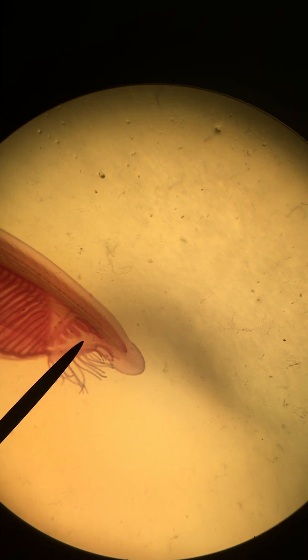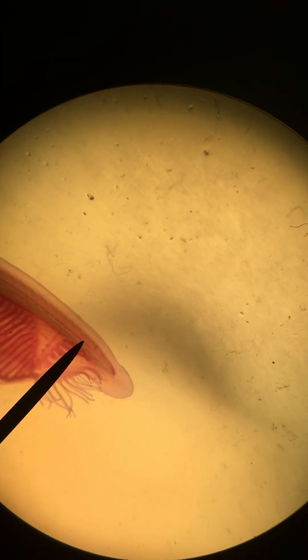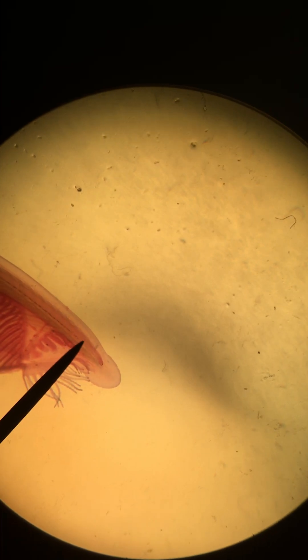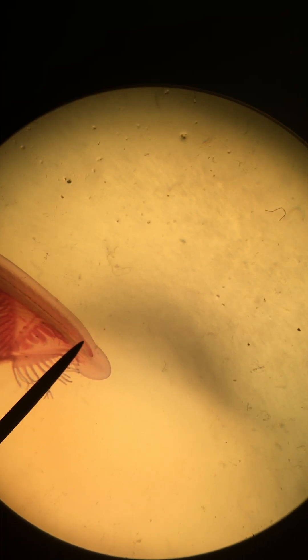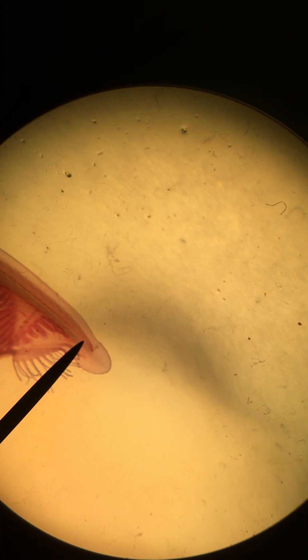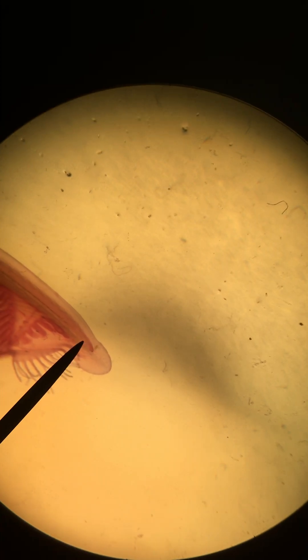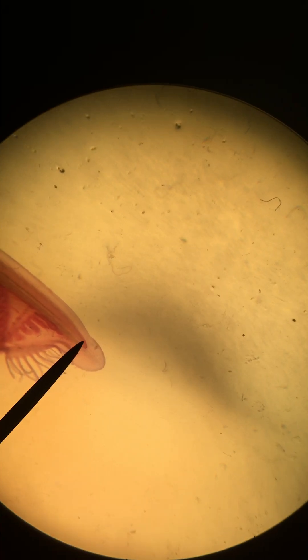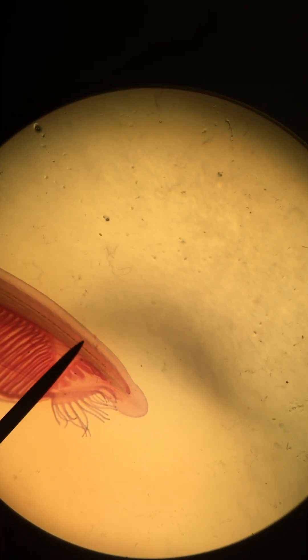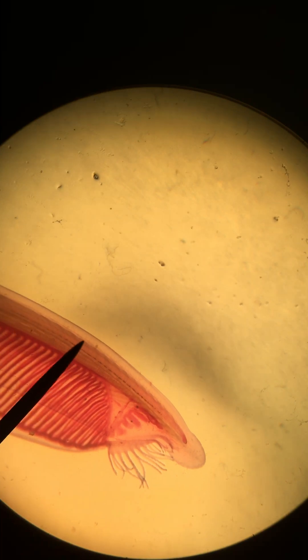If we look at the dorsal side of the organism, we can see the dorsal nerve cord, which terminates in a little tiny bud-like structure here — that's the equivalent of the brain. But then it continues the entire length of the organism, the dorsal nerve cord.